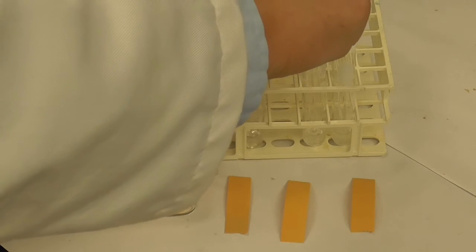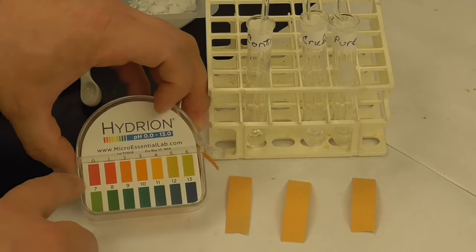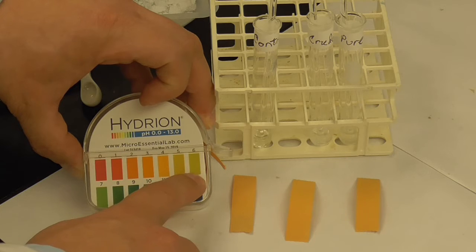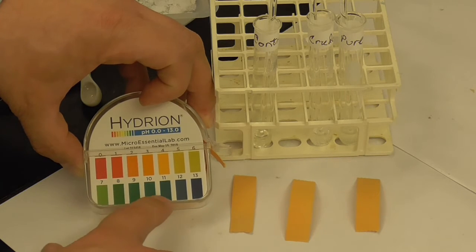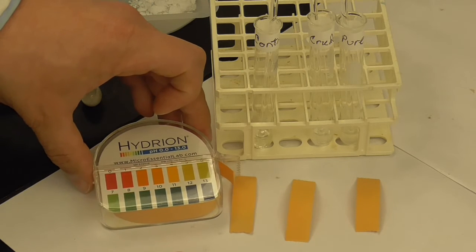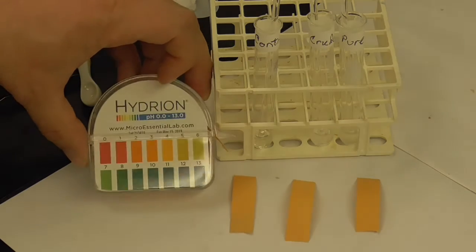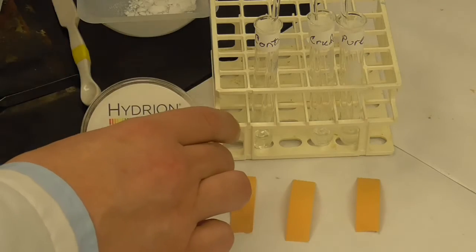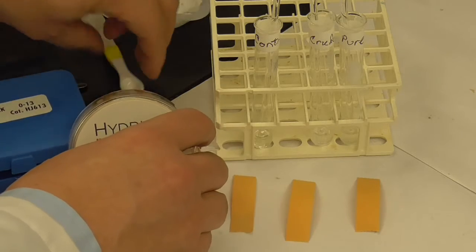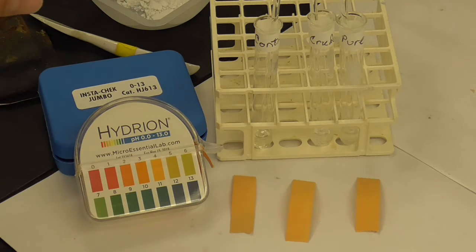Okay, so first though we're going to test the control, and remember what you're trying to do here is judge it based on the color. So 0 is up here at the top in the red, and goes 0 to 6 across the top here, and then the bottom colors go 7 to 13, for pH. Alright, so that's what we're trying to judge. I'm trying to keep this in the shot without getting a glare. Let's see if I can do that. I'll use the box here, prop this up so you can actually see the colors and the numbers.